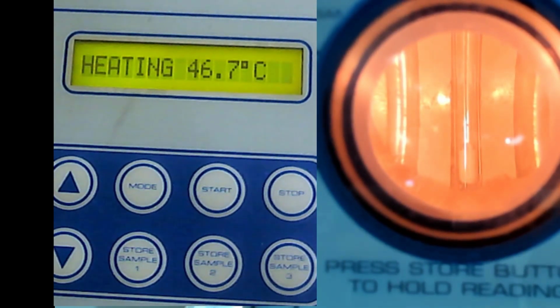So for now, the temperature will go fast up to 100, and we know our sample will not melt at 100, because all our samples will melt above 100. So for timing, it is okay. Any question now for timing? Any question? Why are we waiting until 100 now? Zalika? Yes, sir.